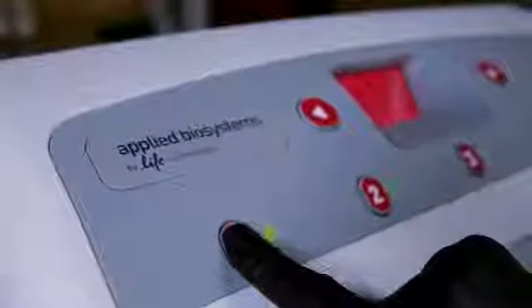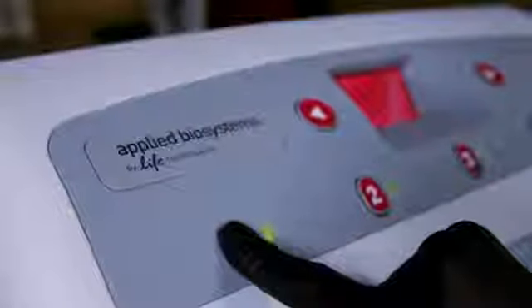If you need to stop the capture cycle to add beads or an elution buffer, press and hold the number button for that cartridge for five seconds. The display will ask if you want to cancel. Press the left arrow for yes, which will stop the run, and let you add beads or buffer. Or push the right arrow for no, and the run will continue.